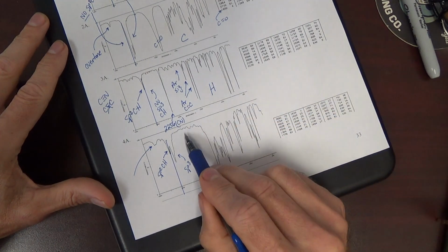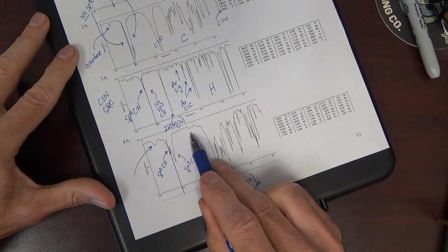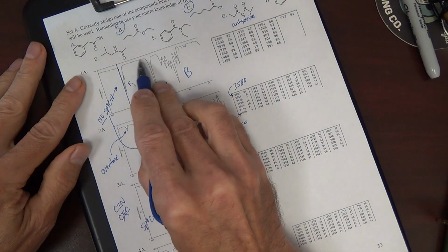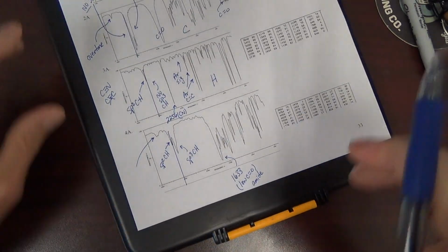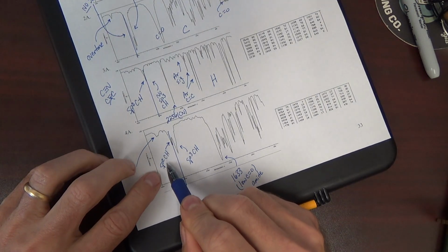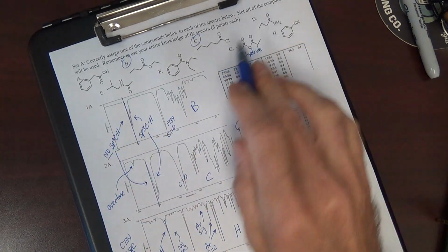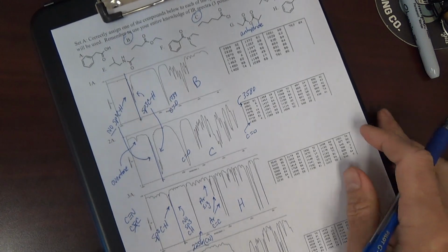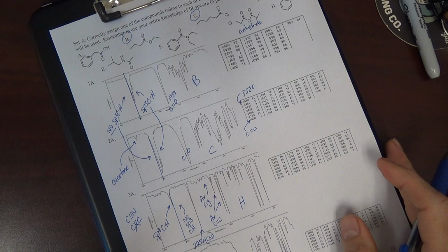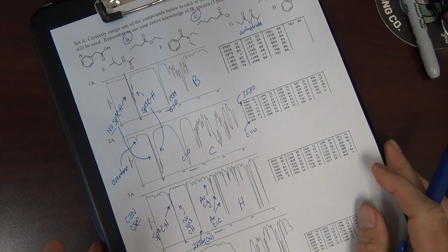Kind of does. It's kind of weak, but it's like a mountain range here. Look at the difference between this sort of mountain range and up here, very top. Much smoother up here, flatter. Also, but this is the kicker, this is the most important: we've got sp2 CH. And if you look at the three amides, boom, boom, and boom, only F has sp2 CH. D and E do not have sp2 CH. All the CH bonds in D and E are sp3 CH.